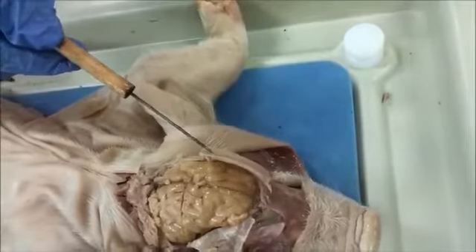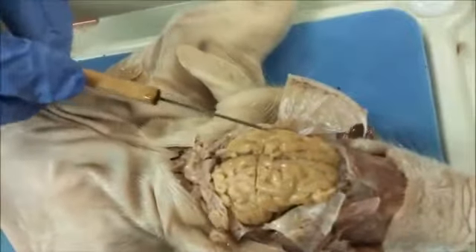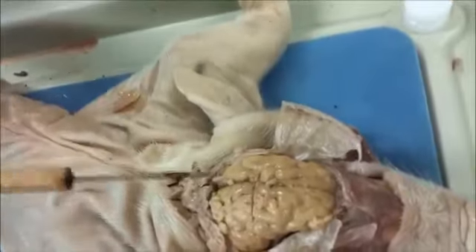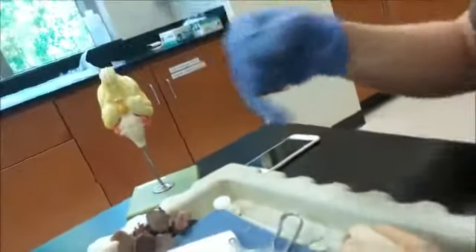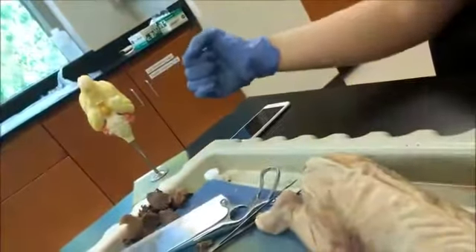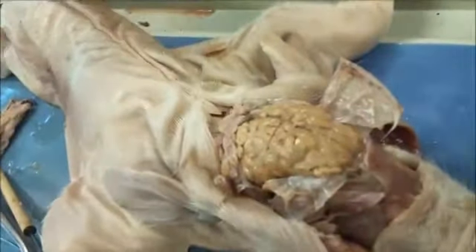Here we pulled back the skull away from the brain. Now the brain is visible. This is the cerebral cortex. You can see with these folds here that the folds are useful because they increase the surface area of the brain, so more can fit in there. And beneath the brain are the olfactory bulbs, as you can see on this model. Right about here. And back here is the medulla, beneath the skull. The model is a model of a domestic dog. So it'll be right here within the pig skull itself.